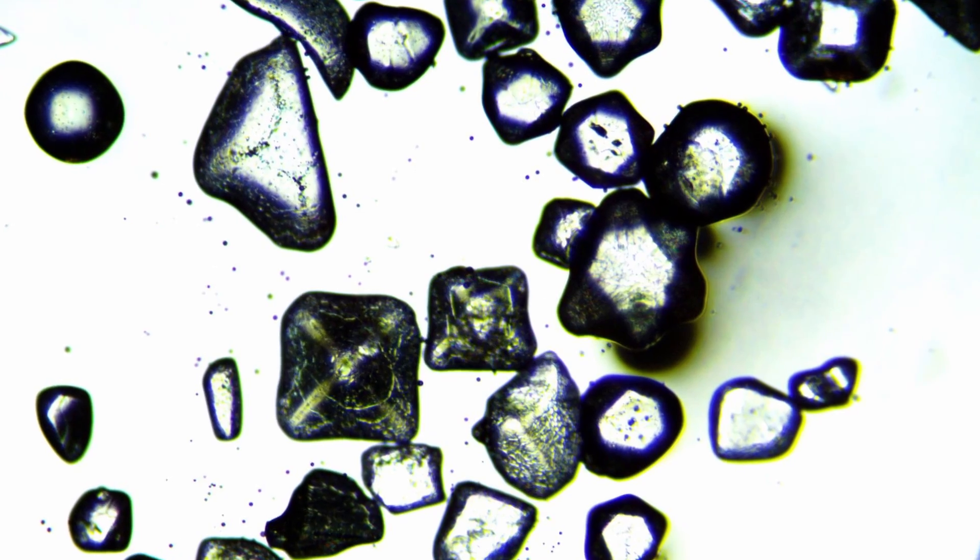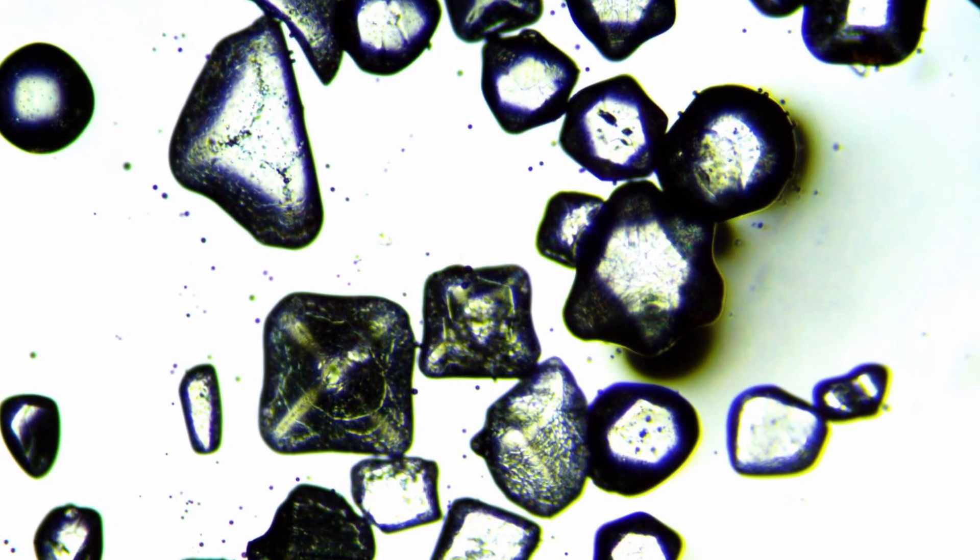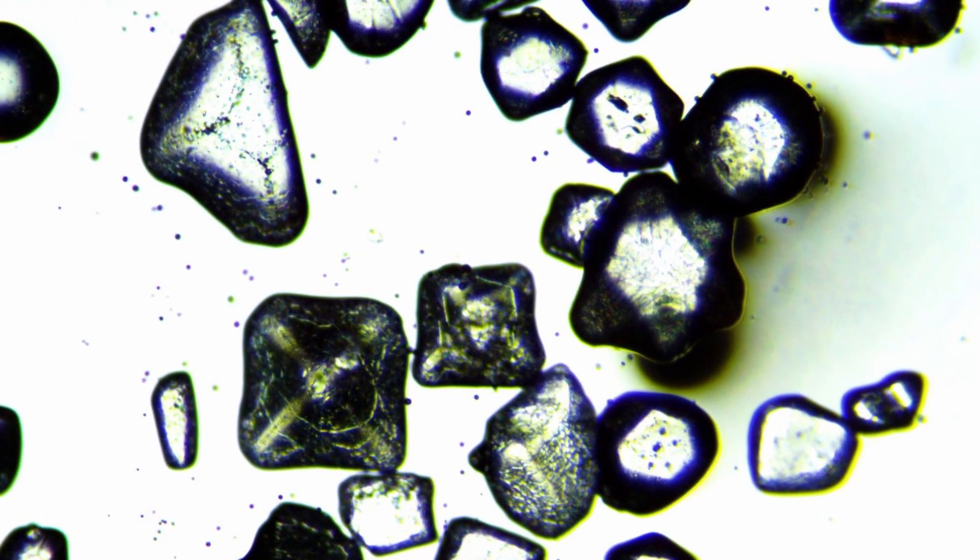I've chosen salt here — these are salt crystals under the microscope — because salt is colorless, essentially black and white, so any changes in color can be seen much more easily. Salt crystals also have very high contrast, so you're able to see the chromatic aberration better. I'm going to show you this first and then explain why there is such bad chromatic aberration here.